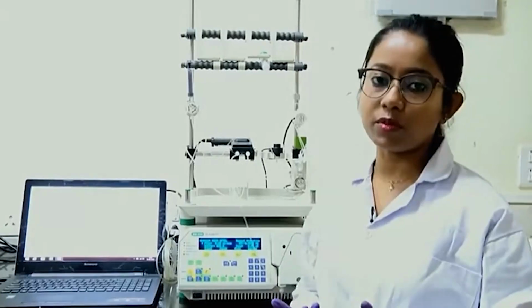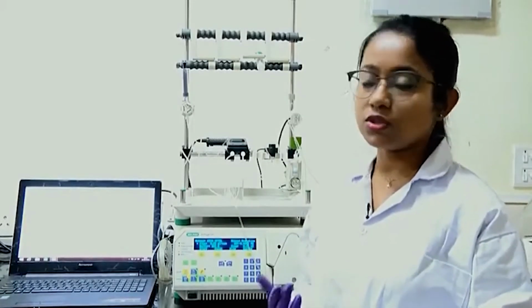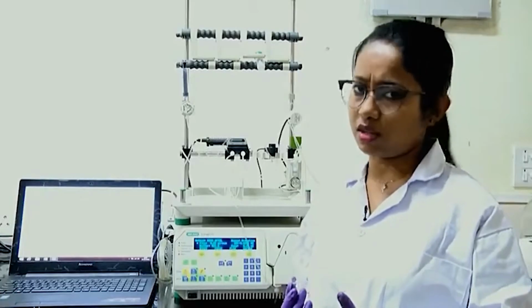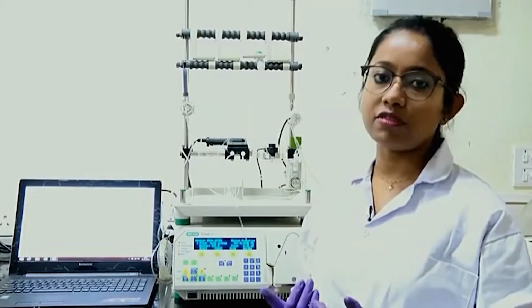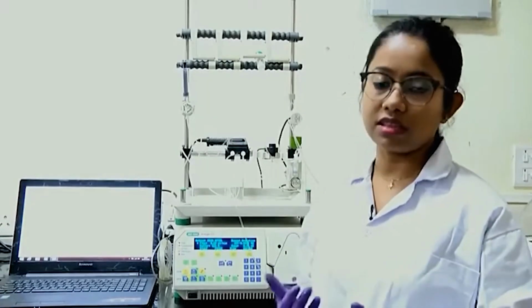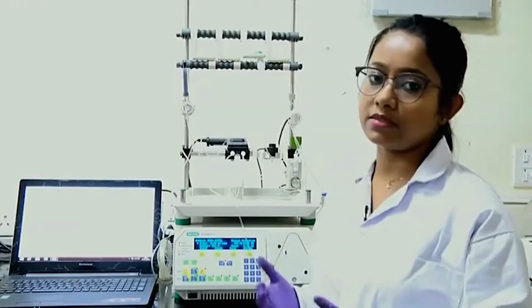Recombinantly we prepare our protein to have this 6x histidine tag, while other proteins are not our protein of choice and we do not want them, but they also might get attached to these nickel beads. So, to remove those proteins from this column, we run a small concentration of imidazole, which will remove those proteins. They have very low affinity because they have 2 or maximum 3 histidine residues. So, those will remove the other proteins, while our protein which has the 6x histidine tag is very tightly bound to these nickel beads because it has a high amount of histidine, and it will not come out. So, by having this 10 millimolar imidazole, it will ensure that non-specific binding does not occur.